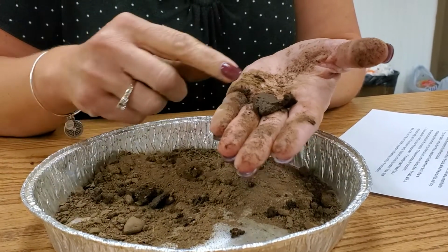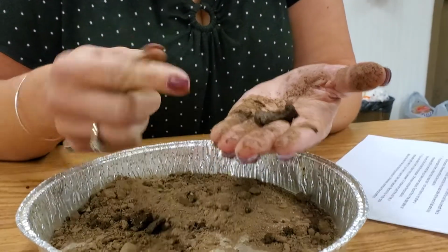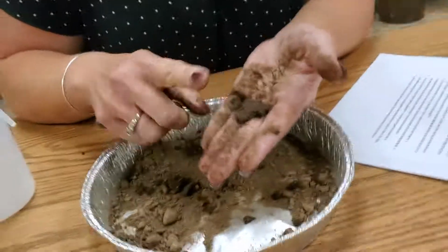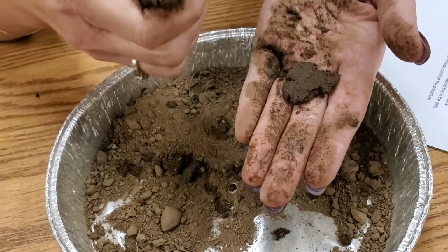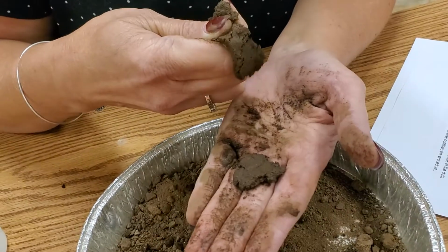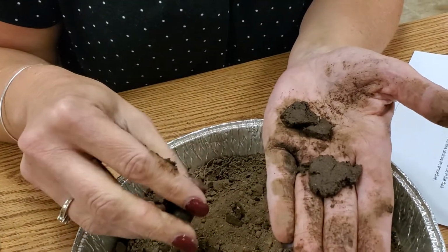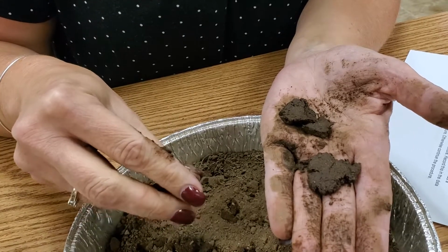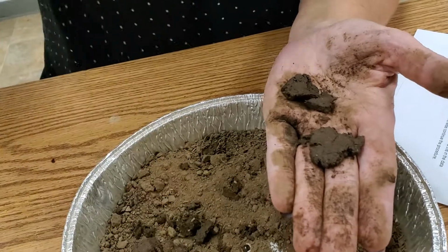So if you're able to form a ribbon that is less than an inch and it has a gritty feel to it, it is a sandy loam texture. That's actually kind of right at the inch mark, and knowing what type of soil this is, I could even try to form another ribbon that's a little bit longer. Okay, and that broke off kind of right there at the end, but that's a good example. So if you're able to form a ribbon that is less than an inch and the soil has a gritty feel, it's a sandy loam.